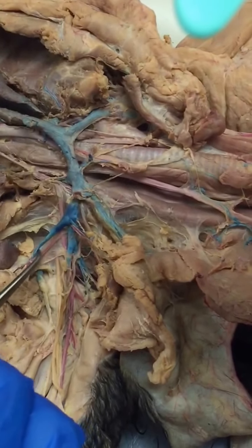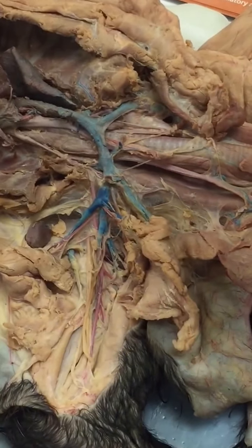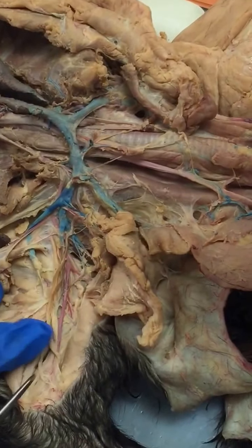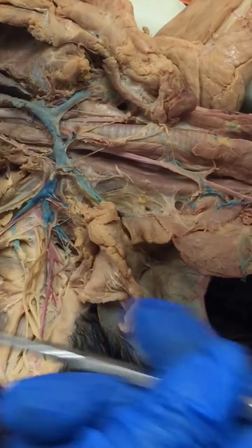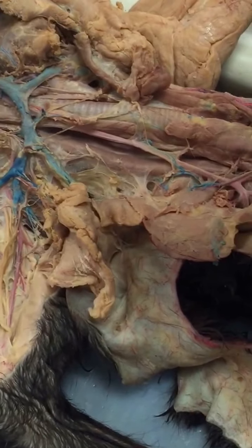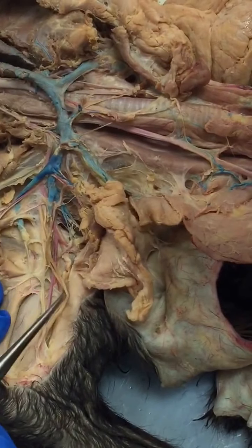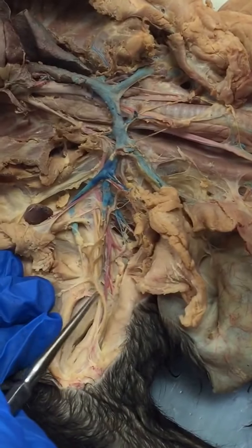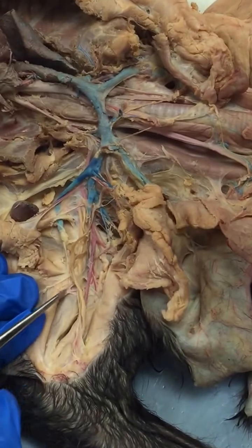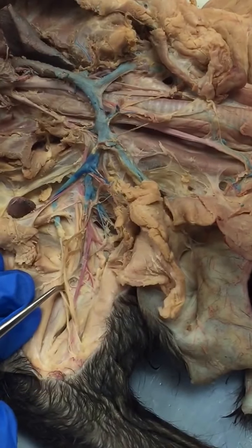So then this is the long thoracic artery, so, longer and branching posteriorly, so long thoracic. And there's only one other branch that's really branching posterior on the brachial artery here, and that's the thoracodorsal. There's a lot of nerves here that get in the way. These are these white strands. But you can see this is the long thoracic, and the shorter parallel one to it that's more distal, meaning towards the paw, is the thoracodorsal here. So we have long thoracic and thoracodorsal.